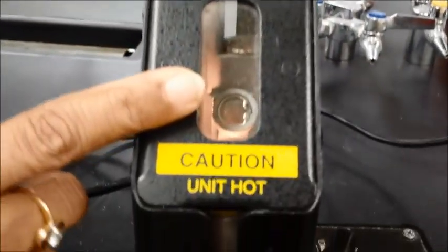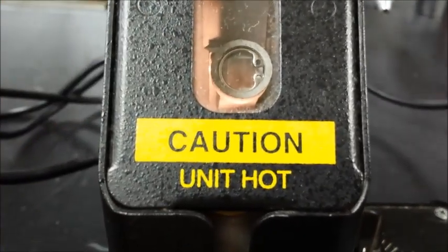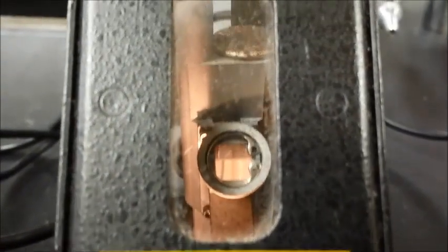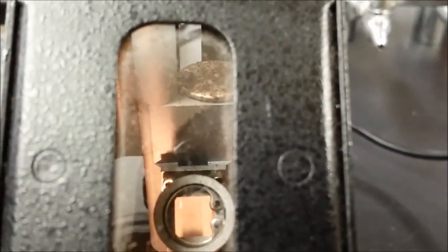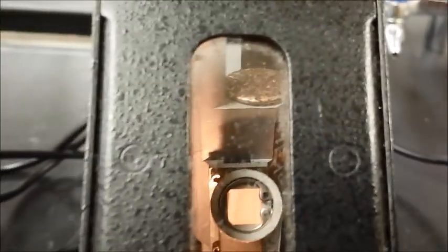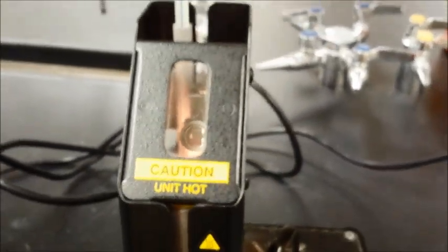So now I am going to go ahead and place the sample inside. So you can see how to place the sample. There are 3 slots in there for sample, and you can place it in any one of them. And so here is the sample, you can place it in any one of them. And you should be able to see that clearly.